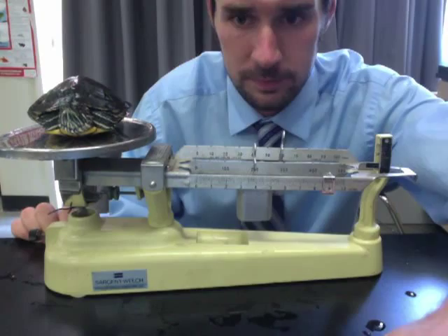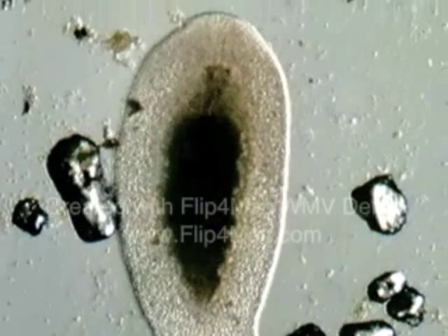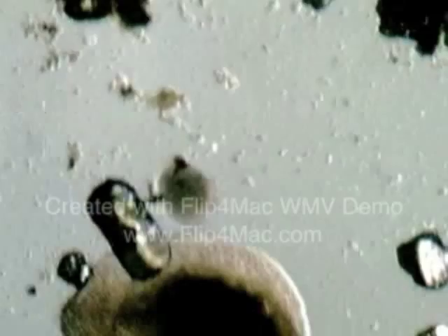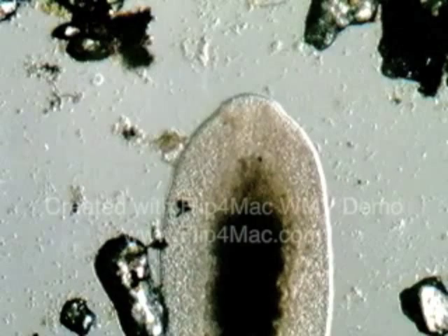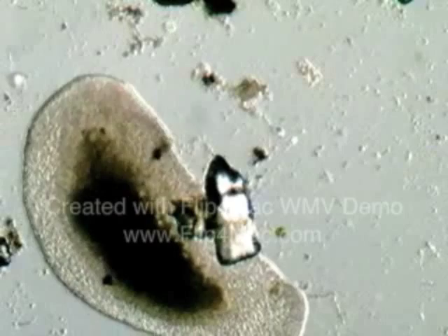The issue is that these tools can only measure things that are larger. What you're seeing now are microorganisms so small that the human eye can't see them. In order to observe their interactions and how they work with each other, we need to use a microscope. A microscope is a tool used to examine objects too small for the naked eye.